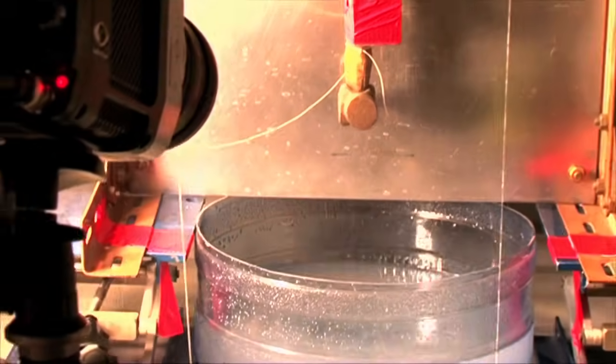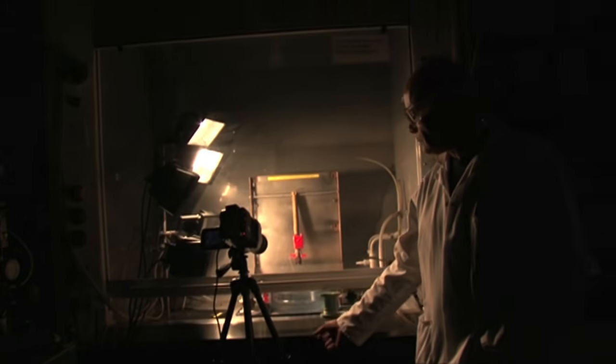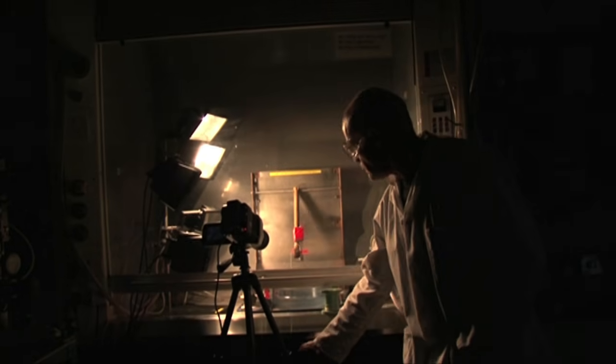This is not a carefully controlled scientific experiment. Of course, it's controlled so it's safe, but we haven't fixed every parameter in the way you would do for a carefully adjusted experiment.